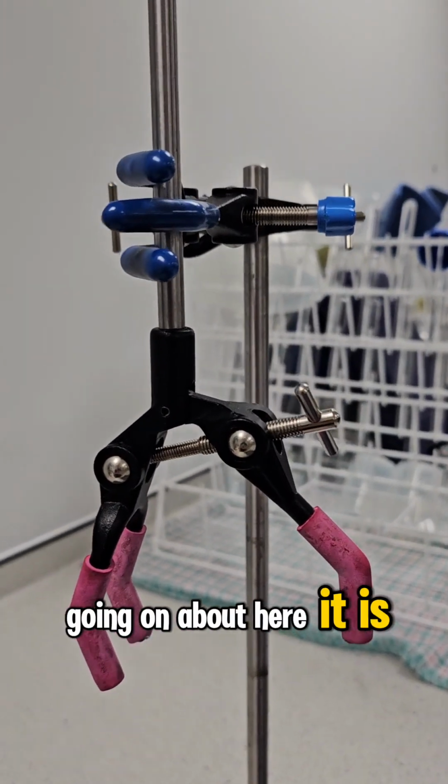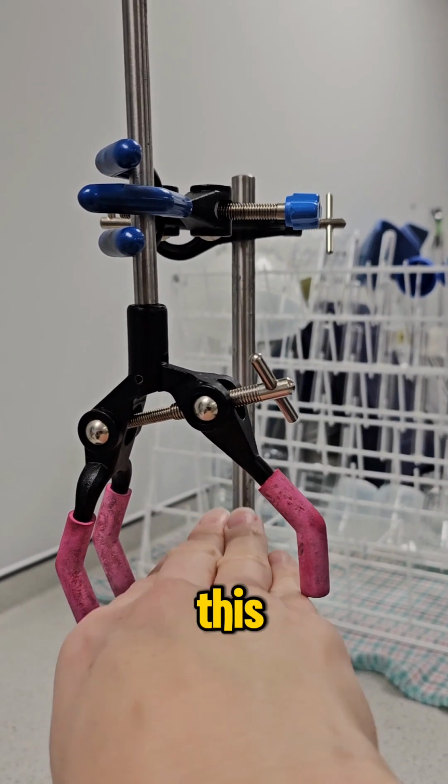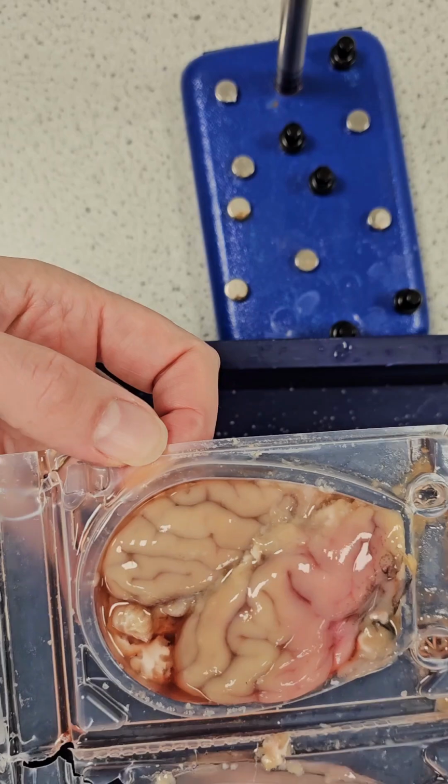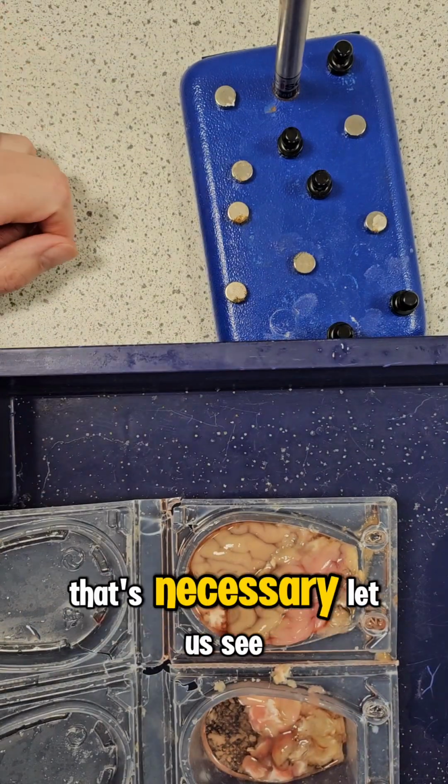Here it is. This was clamped. So it was in here like this. That's going to be like this. So you can see the texture of it. Look. It's kind of squidgy looking. I've got a scalpel, but I really don't think that's necessary.